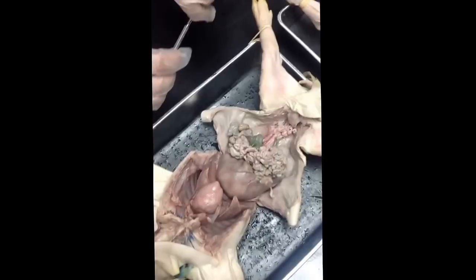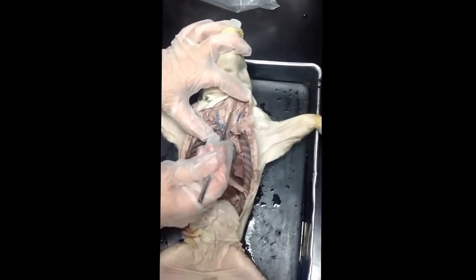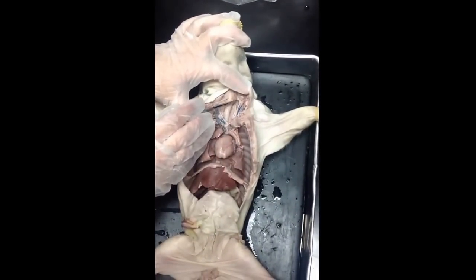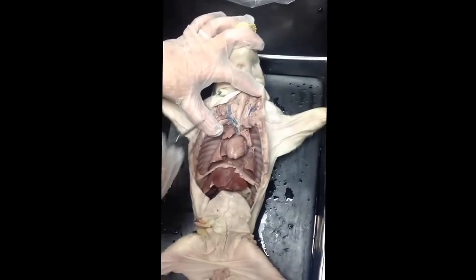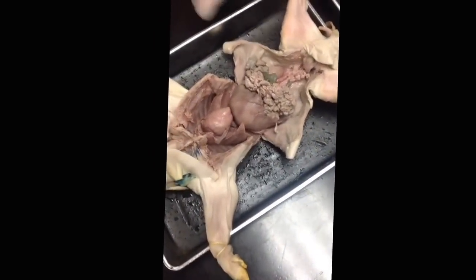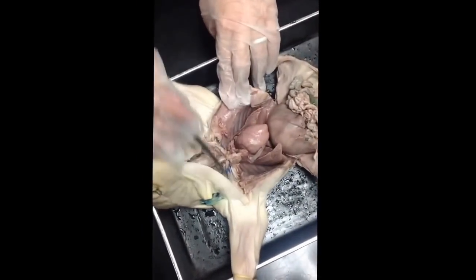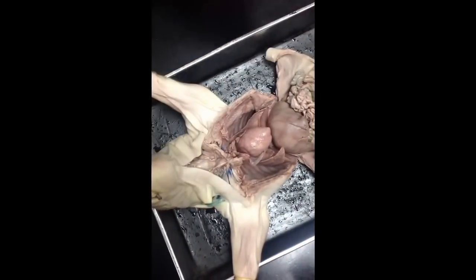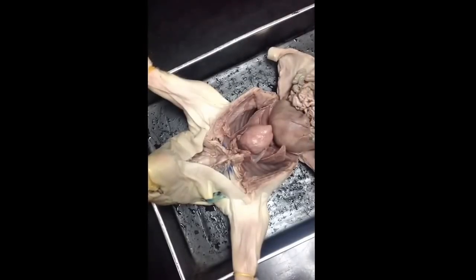Okay. And the blood vessels in the neck, you're looking for pink, blue, blue. So here's the trachea. Here's your common carotid, internal jugular, external jugular. So internal versus external is easy because internal is more medial than the external one. For the blood vessels that are going into the shoulders, we are simply going to group them as subclavians. We tend to obliterate them, so we're just going to group them all together.